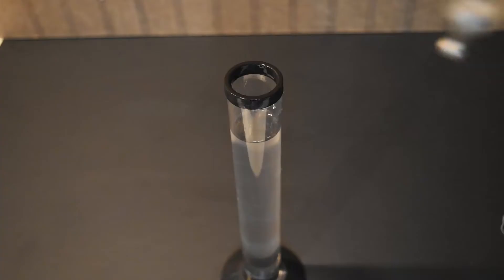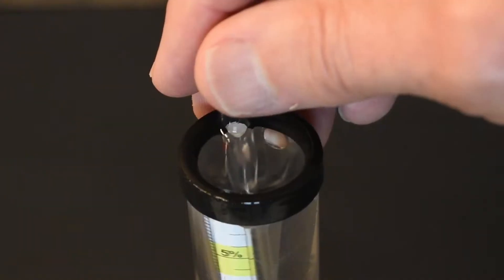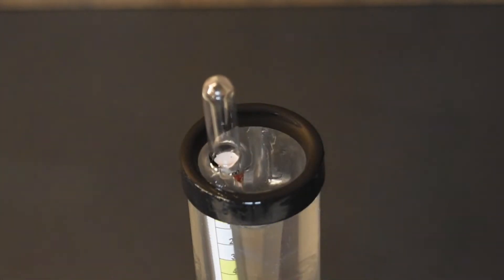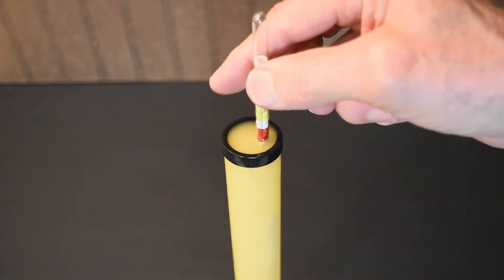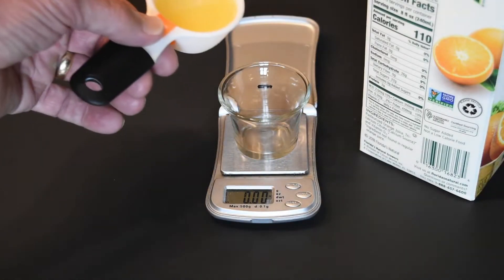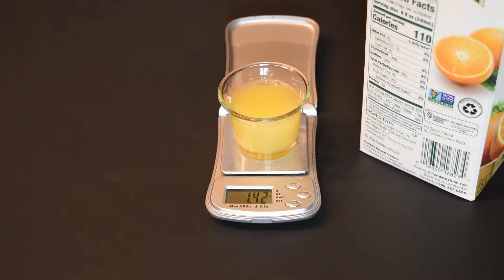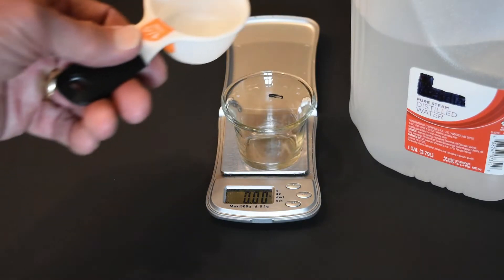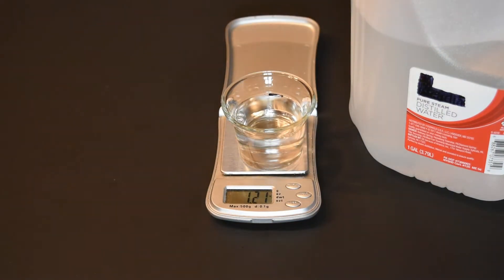This is alcohol, and the hydrometer reads less than one. This is orange juice — the hydrometer reads 1.048. The orange juice contains sugar. If you weigh equal volumes of these liquids, you can see the differences in their weight. The orange juice is heavier than the water, and the water is heavier than the alcohol.